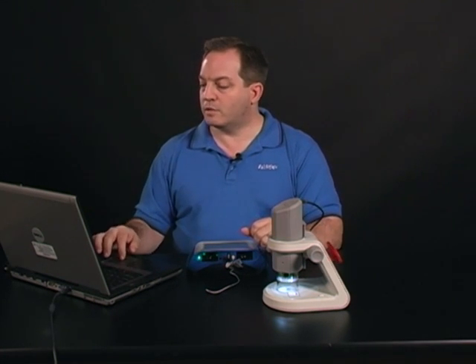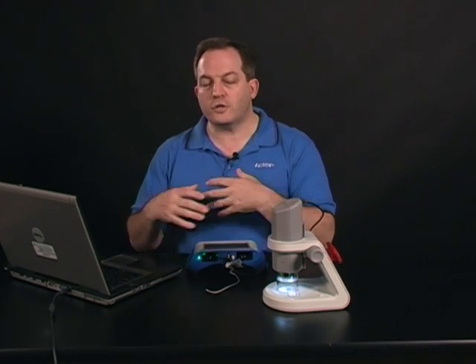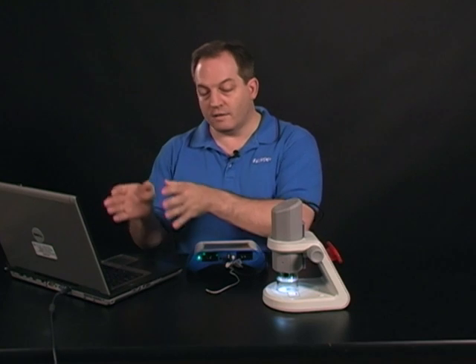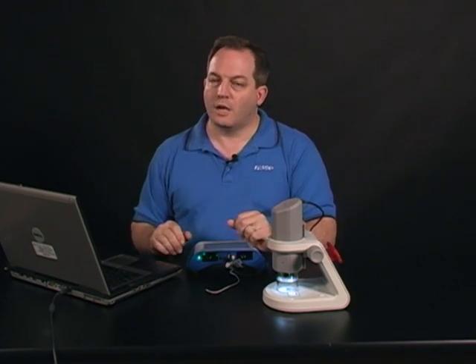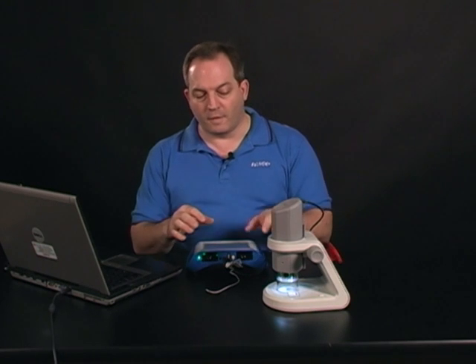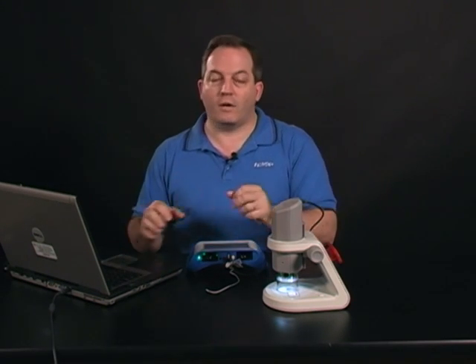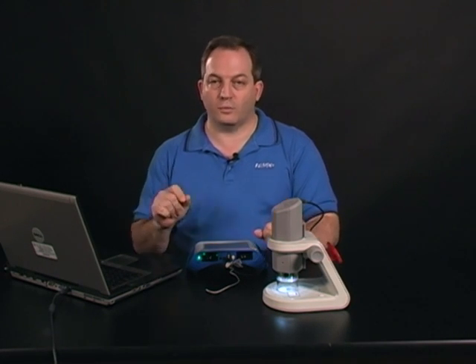So now I'm going to want to give that a more real-world measurement. So to do that, I'm going to measure an object of known length. So if I had an object of known length within the image, I would go ahead and use that. I happen to know that for this particular setup, on this 10x setting for 100 power, that 500 pixels is approximately equal to 1 millimeter.